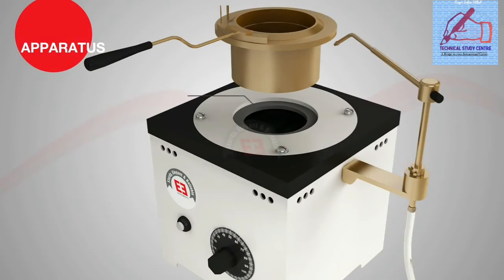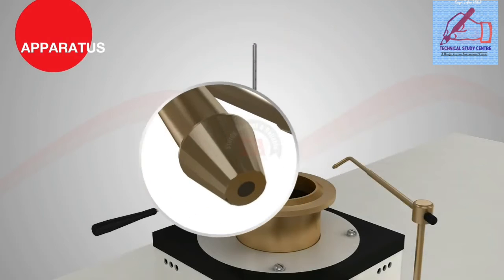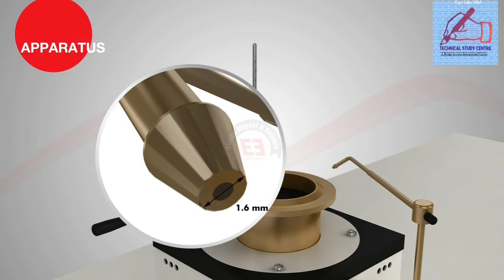The heating plate is of sufficient dimensions and material to ensure that the thermal heat to the test cup is only applied to the bottom of the test cup. The heater is controlled by suitable energy regulator. The device for applying the test flame has a tip of 1.6 mm in diameter, having an orifice of approximately 0.8 mm plus or minus 0.05 mm diameter.